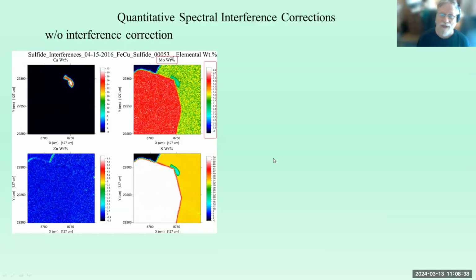We can also do interference corrections in maps. Here's an example of 2 sulfides. You can see that one has more sulfur than the other, and so you might guess at what those are. If we look at the molybdenum map here, as we all know, there's a large interference of sulfur on molybdenum. And you might think here, oh, we've got maybe 1.8% molybdenum here, and maybe, what's that, greenish yellow, 1.3% here, and this little phase here has almost no molybdenum.